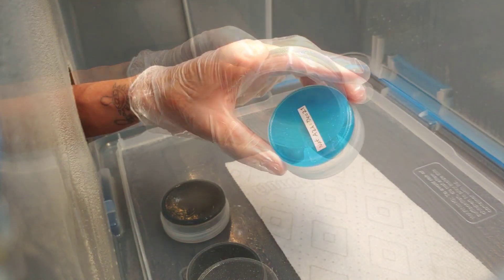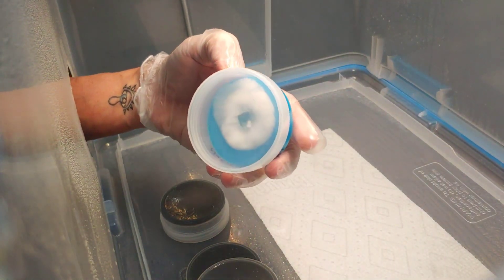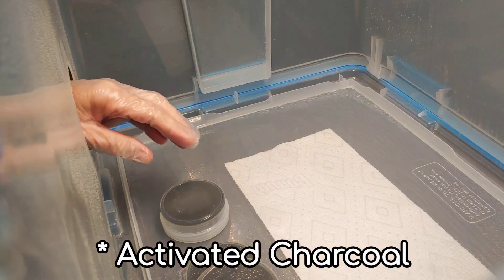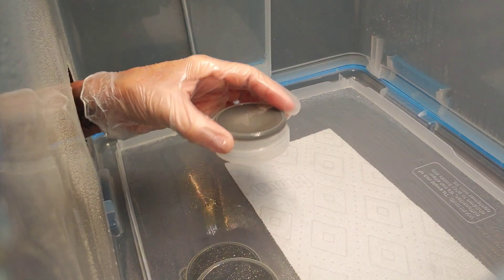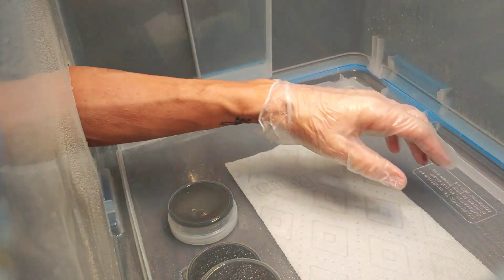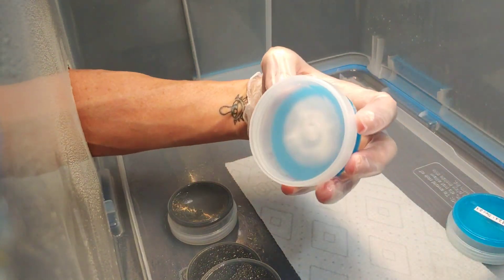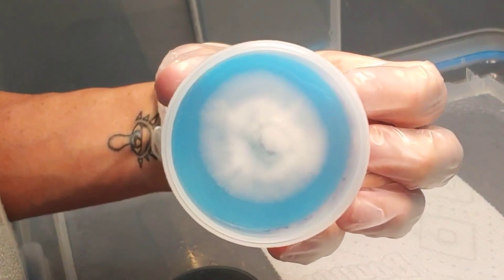One of my patrons told me about activated charcoal and I haven't tried it yet. This last batch I did with it — it's supposed to help against contamination and it's more inert. You can even eat the stuff. I made a short little run because I'm going to be doing some agar transfers later. Here are some that I'll probably transfer later on, but I'm going to let them grow a little bit — they're nice and pretty, look at that growth.